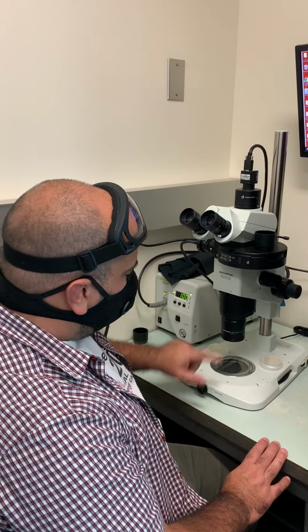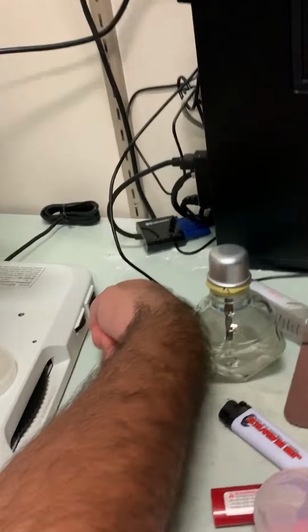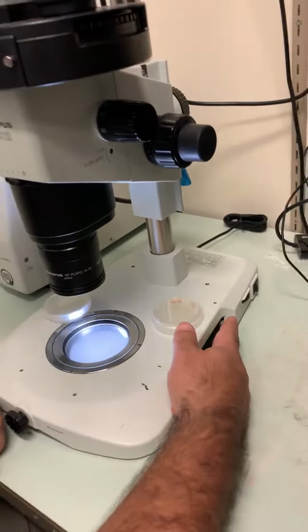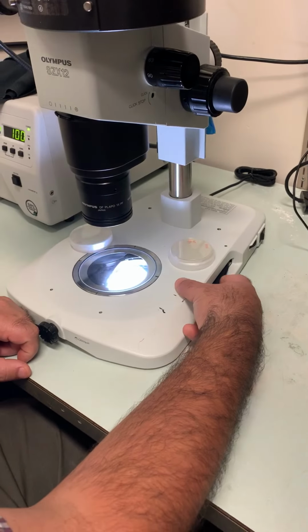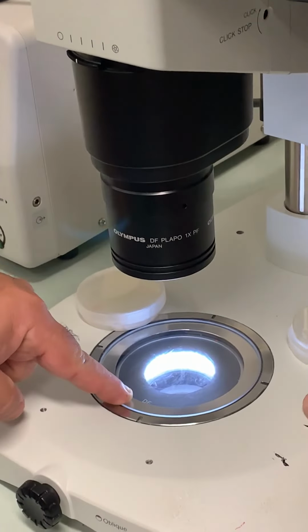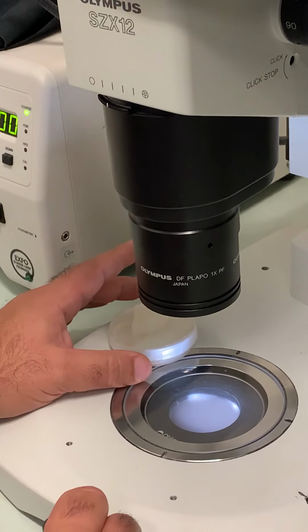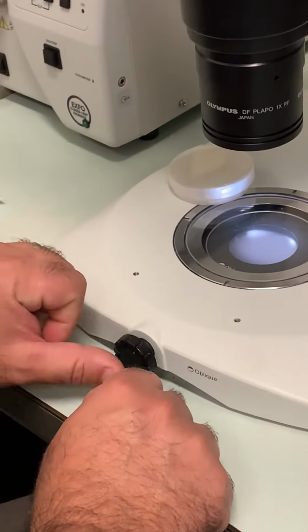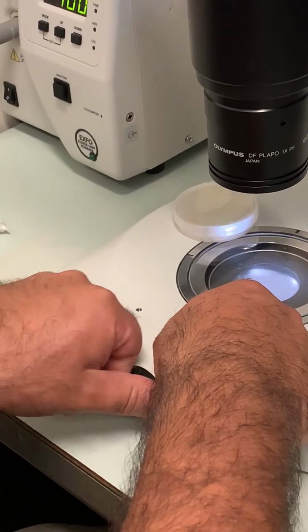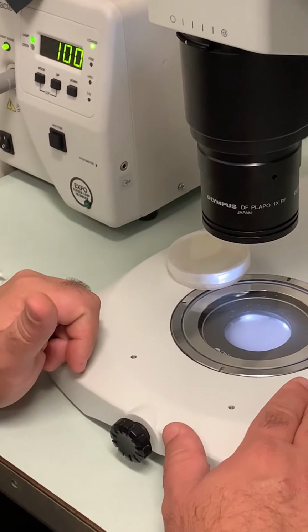This is a dissecting scope. The light switch is at the back here. You can turn it on, and then there is a dial that makes it brighter or dimmer. There is a wheel here that you can rotate to choose different mirrors. The DF is for dark field, and the oblique is the one that we usually use to look at worms. If the oblique setting is on, you can see the mirror moving in angle, which reflects the light in different directions and makes it easy to see the worms.